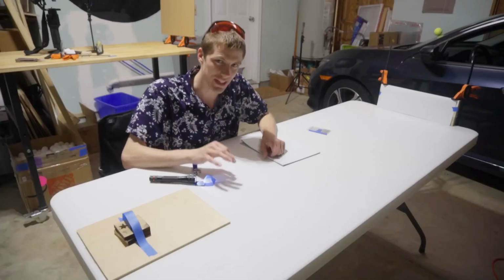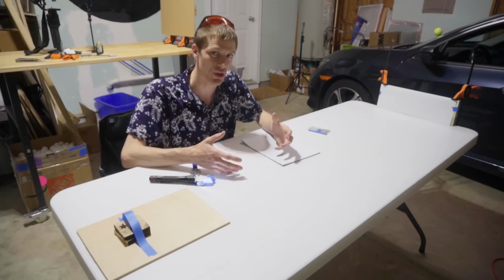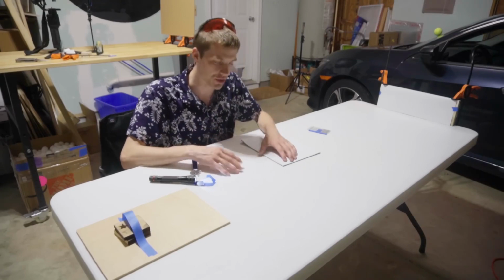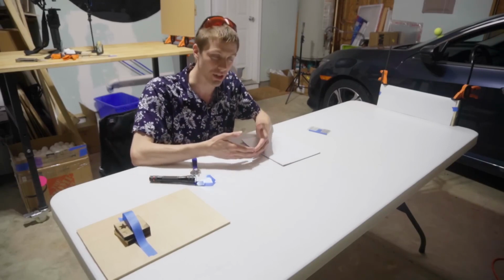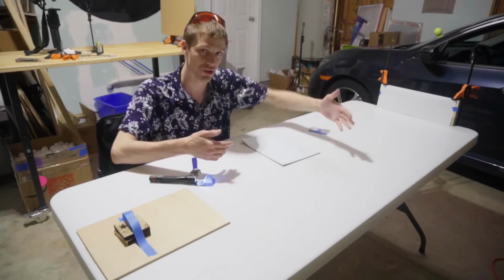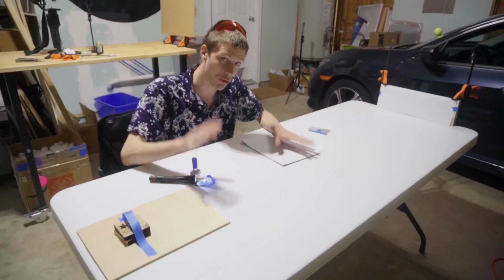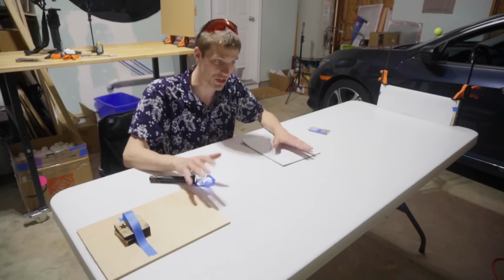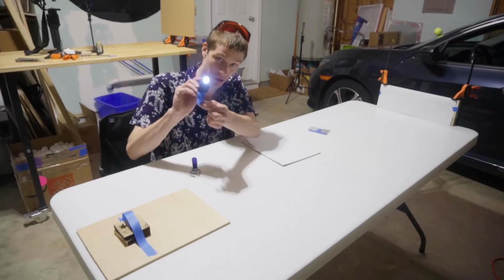A transmission electron microscope is basically casting shadows with a beam of electrons. You're shooting a high energy beam of electrons all the way through a material, and you're projecting whatever gets through out onto a screen and looking at that image. Now, because it is so much easier to visualize this when you don't use electrons, I'm going to be doing a demonstration with photons.